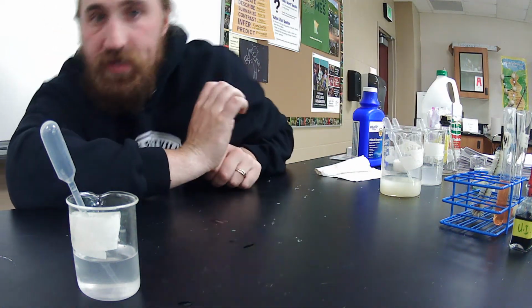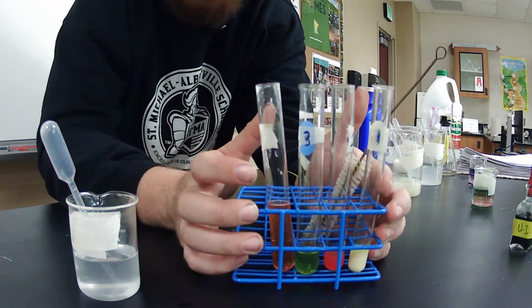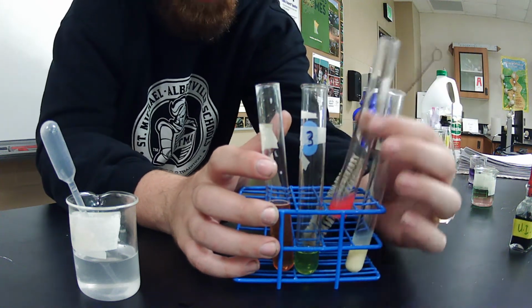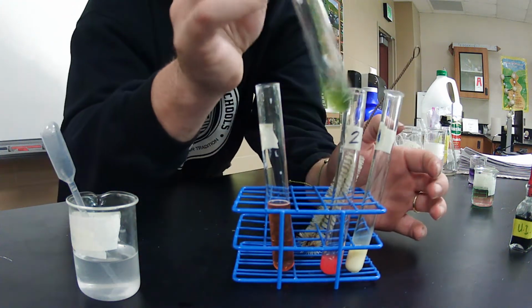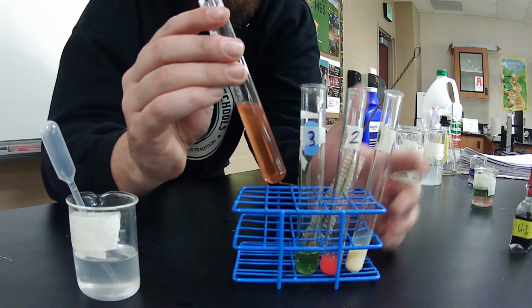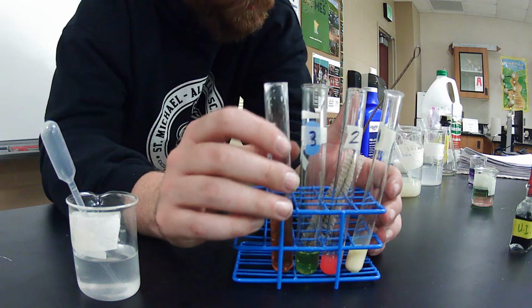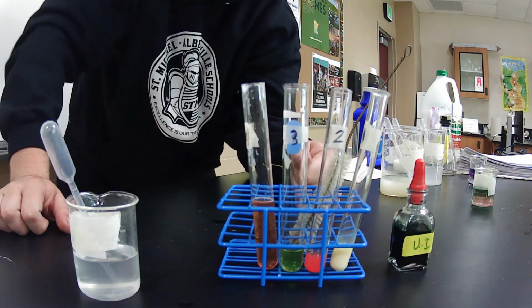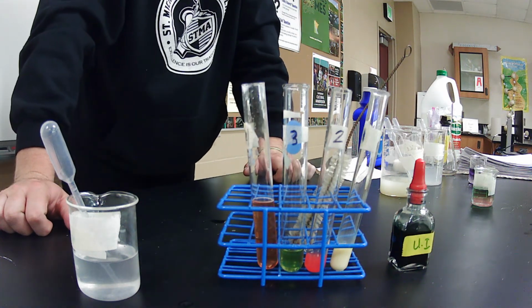So today, just to recap what lab was, we looked at 3 different things. We looked at milk, put some universal indicator in it, turned out yellow, acidic. Tested lemon juice, tested acidic. Tested hand sanitizer, tested neutral. Then we played with milk of magnesia just to see how long it would really take to overcome a buffer. Once again, guys, universal indicator deals with pH. Other than that, I think this is about what lab got us today.